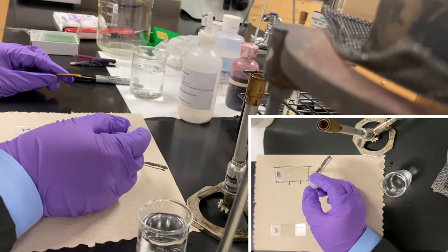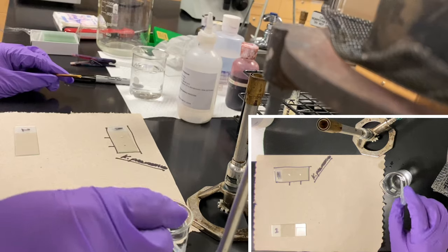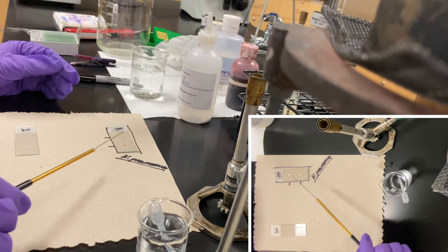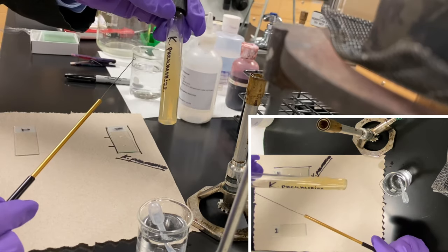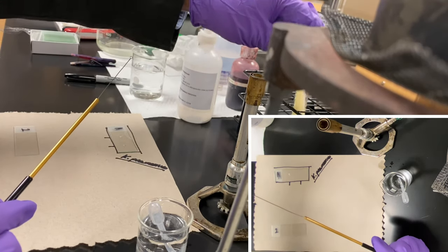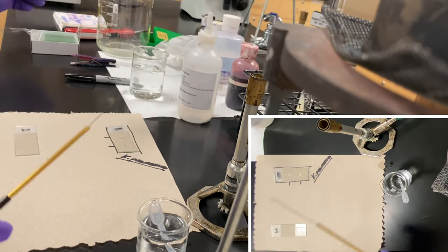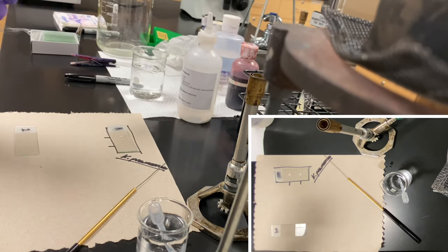Tiny little drops. And then now I want to aseptically transfer my organism, which is Klebsiella pneumoniae. So we have to follow all the rules. That means I'm going to check my gas line and check everything else.